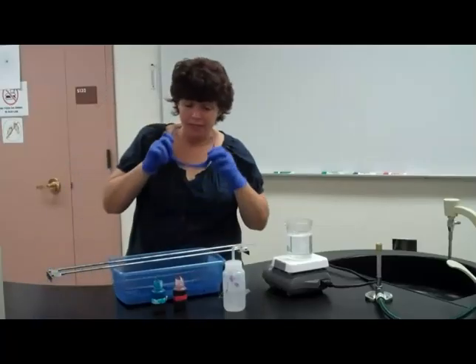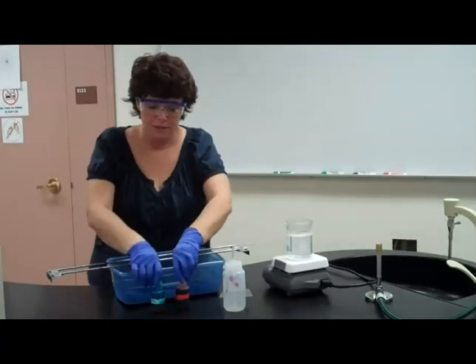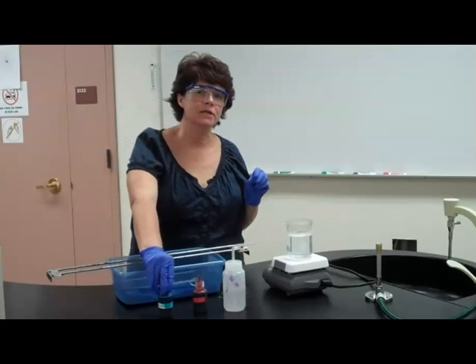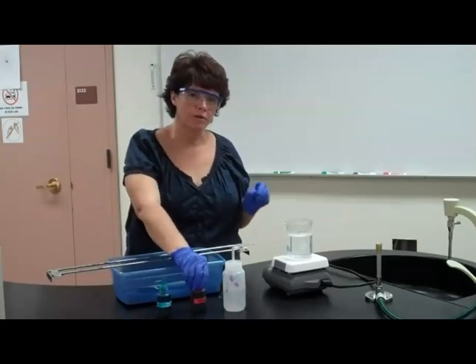The endospore stain is similar to the acid-fast stain in the fact that we're going to use heat. The difference is there's only the first stain and the second stain. The primary stain in this case is not staining the outside wall of the bacteria, it's actually staining the endospores. Then your counter stain will stain the wall of the bacteria.